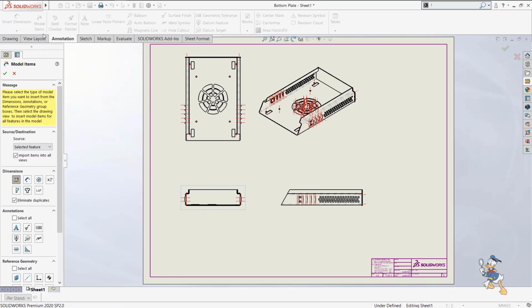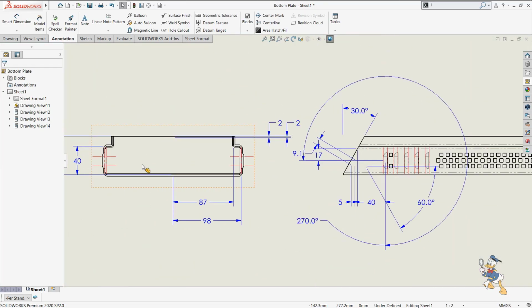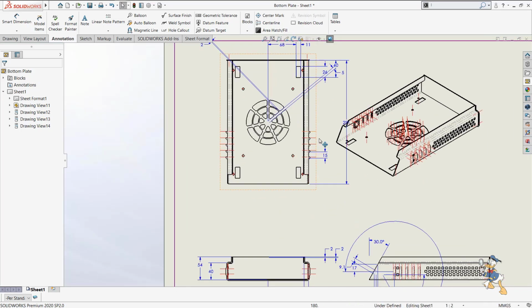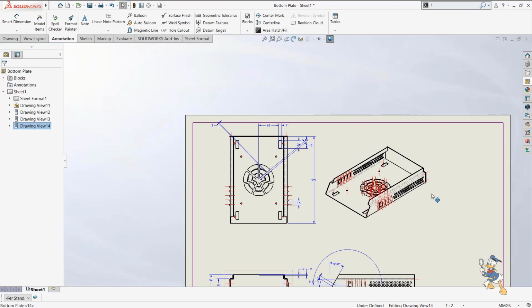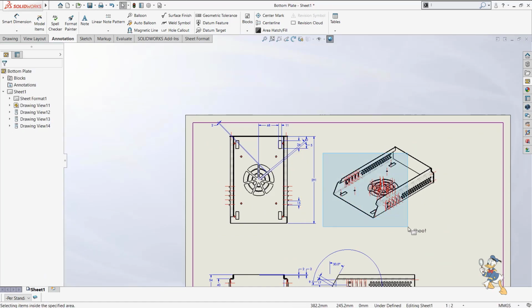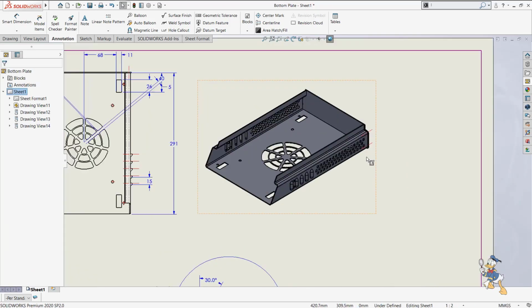Suppose I need to generate some dimensions for this. I just need to select the entire model, and it will generate the dimensions for me automatically. I don't need to invest my time in generating the dimensions in the drawing feature. As we can see, it generates dimensions where I need them. It automatically gives some center lines. Whatever the dimensions are, they automatically come into this. Suppose we don't need some center lines in this model, so we can delete them as well. We can make the 3D feature visible like this as well.